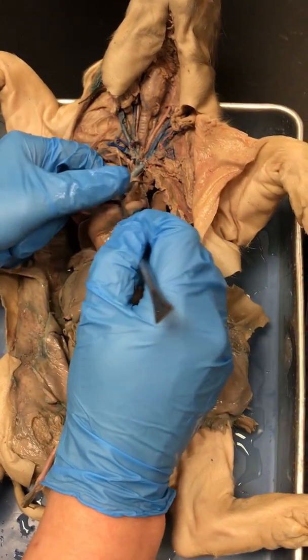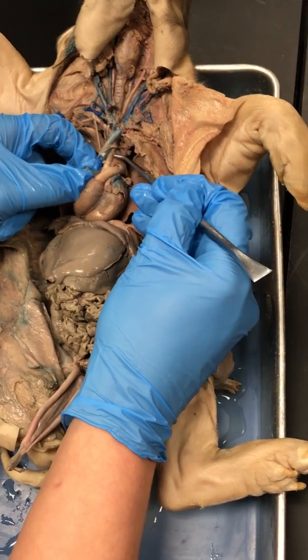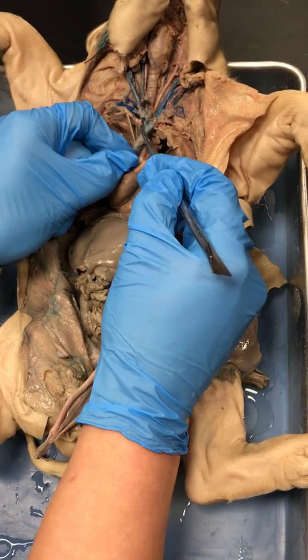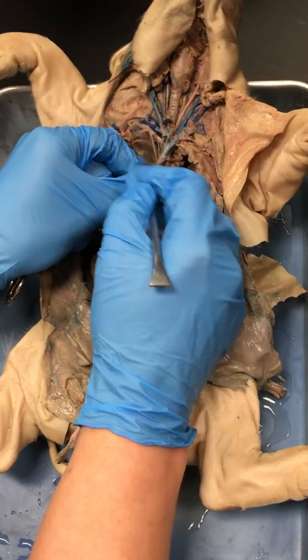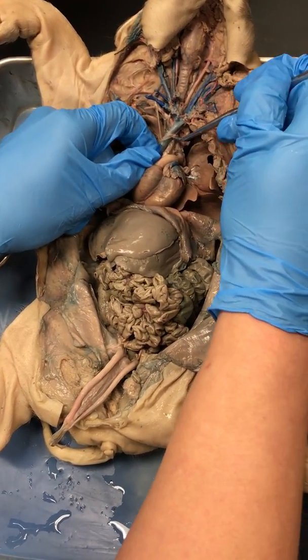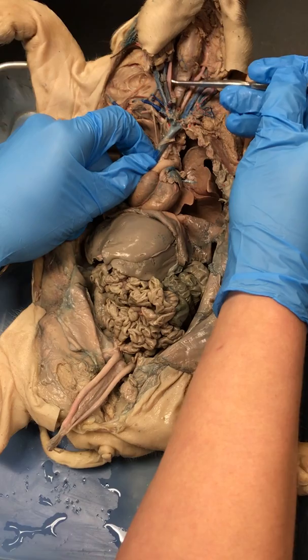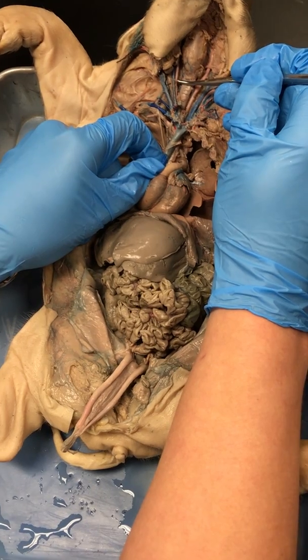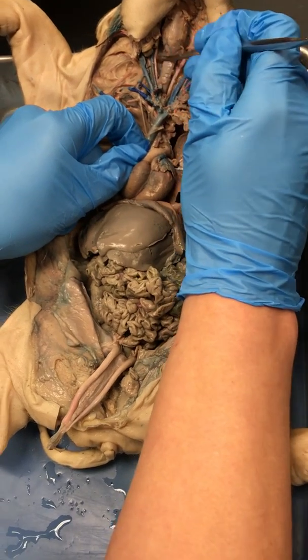If I come back over here to my aorta, this is an artery, right? When I go up from my aorta, this is my brachiocephalic trunk. And then when I look at it split, that gives rise to my subclavian arteries. Coming on up, you can pay attention to your brachiocephalic trunk giving rise to both of these large arteries going up through the neck. Both of these large arteries are my, anybody want to help me with this? Carotid, right? These are my carotid arteries, okay?